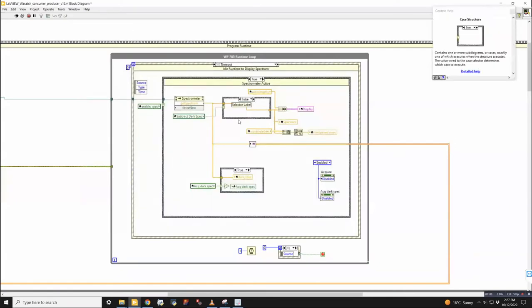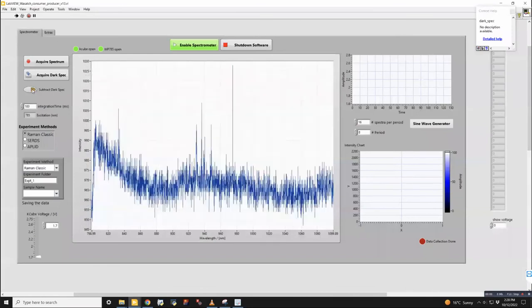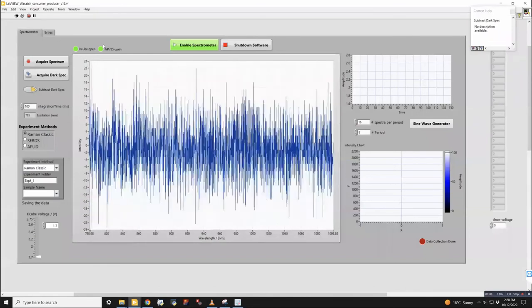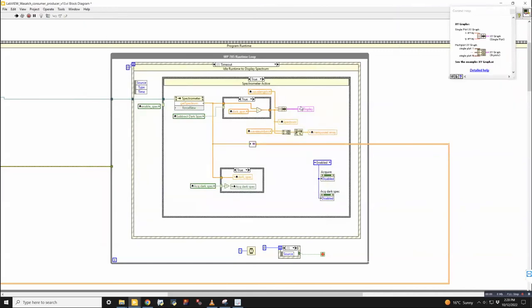Right now, this is false. So the dark spectrum is actually not being subtracted from the display. But if I click true, then it will subtract it. So basically, when this is enabled here, it will always subtract that before it goes to the display.